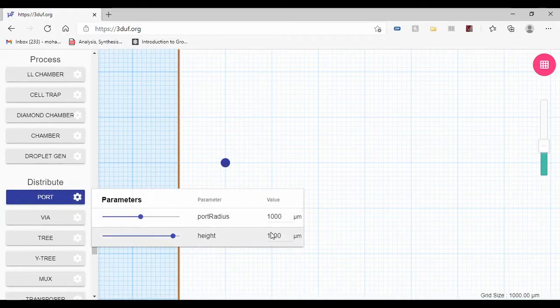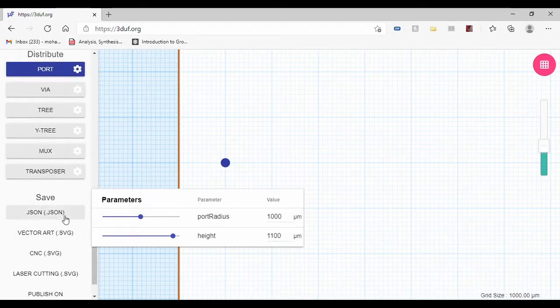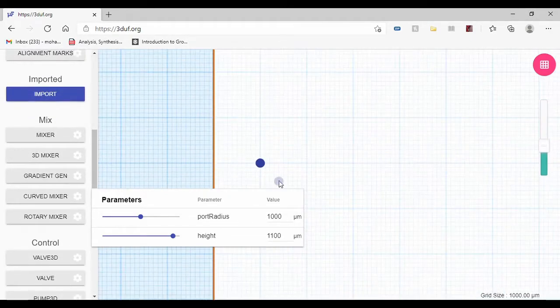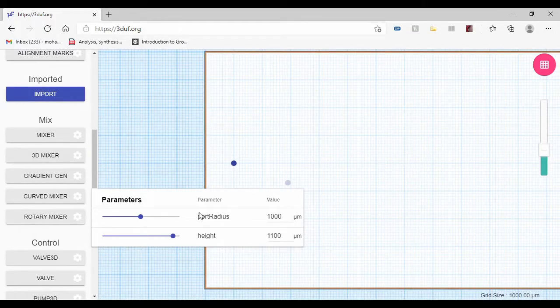Also, you can change the height, but it's really not important if you're dealing with vectors and you want to export your design as vectors. But if you're going to export it as a JSON file, then yes, the height is going to be stored, in case you're using a machine that takes a JSON file format. So this is my first port, and let's say the second port is going to be right there, but I'm going to increase the radius a bit.